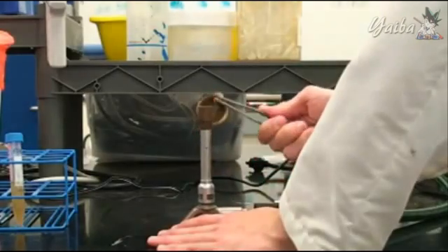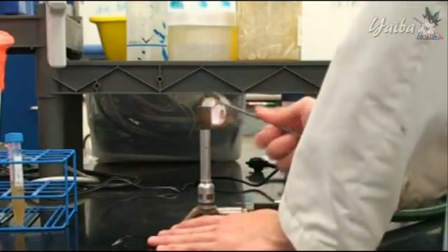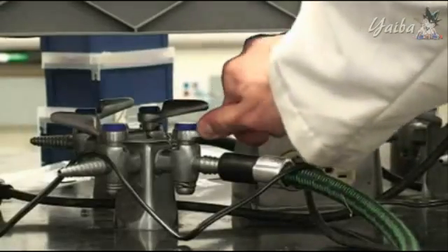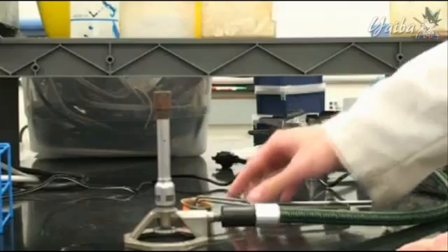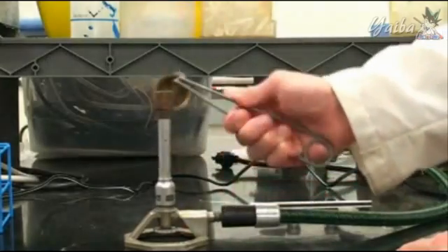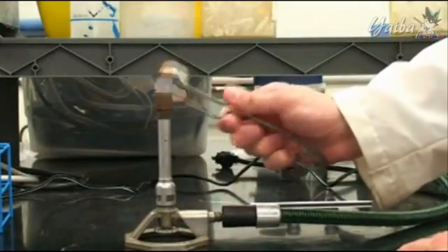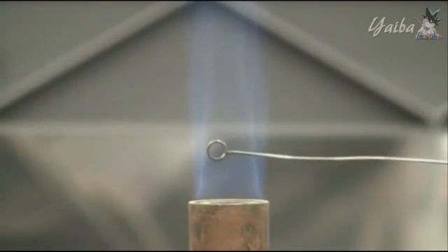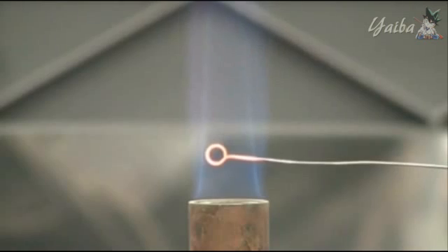The Bunsen burner is fueled by gas and will never burn unless its hose is connected to a valve located on the workbench and the valve is open. Once the gas is flowing, use the provided torch or flint to ignite the fumes. The wire end of the inoculating loop needs to be heated to redness with the Bunsen burner to sterilize it.